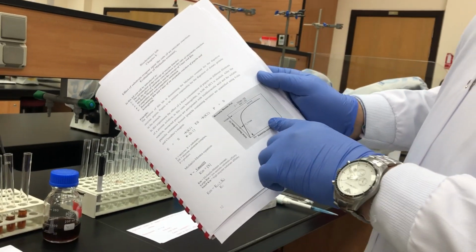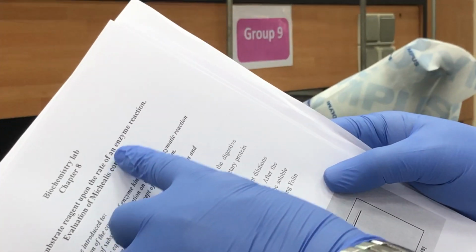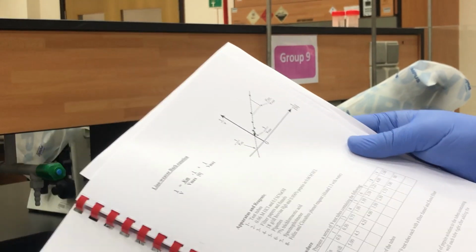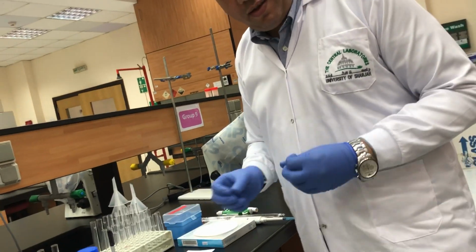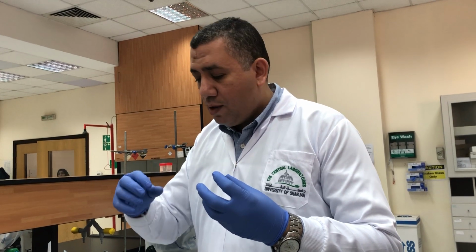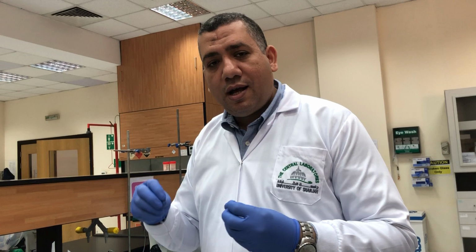So today we would like to prove this graph in the test, showing the effect of the substrate concentration upon the rate of an enzyme reaction using the Michaelis-Menten equation. Our procedure today will start with preparing 9 tubes. The concept of the test, as I explained in the theory part, is that we have a protein. When we add pepsin in acidic media, we get a polypeptide. This polypeptide can react in basic media with Folin-Ciocalteu reagent, and we will get a purple color.